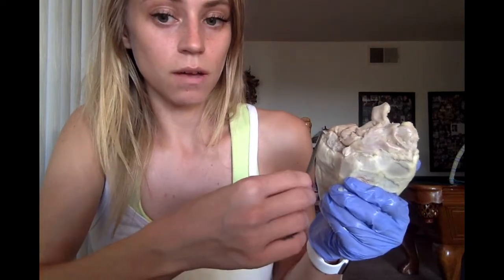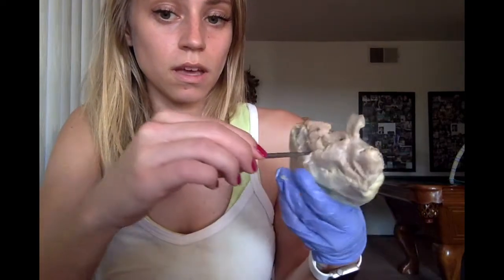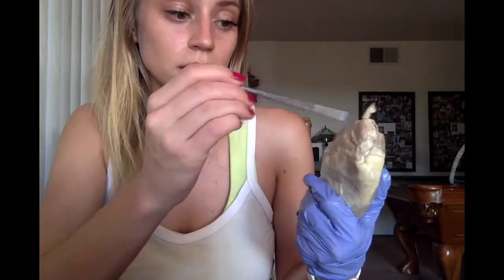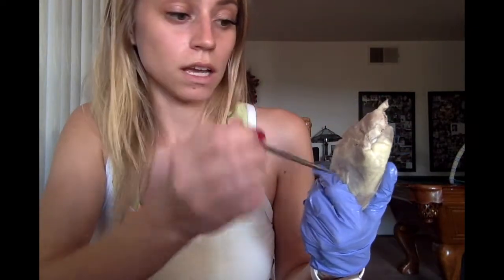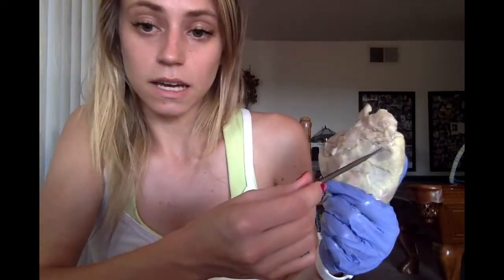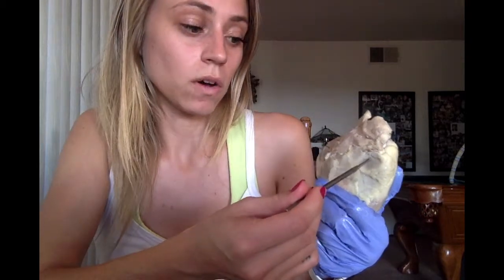The blood from all these vessels is going into the right atrium, so the coronary sinus, the inferior and superior vena cava, the blood from these are going right into the right atrium, which is here, and they are all veins, and they are all carrying deoxygenated blood.